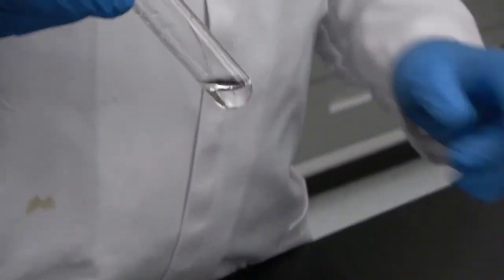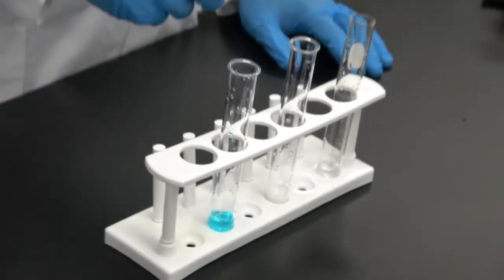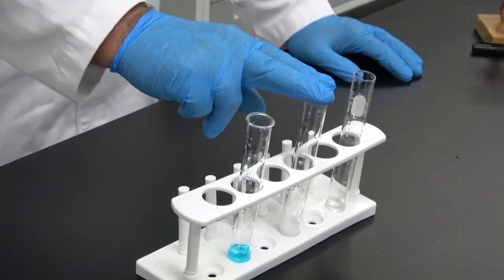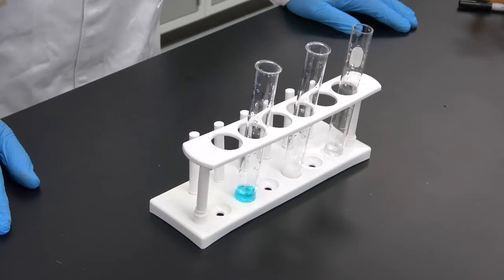In this case, we have elapsed about a minute and a half of time, and you see that there is no precipitate formation. So the last part will be no formation of precipitate, and no formation of precipitate for each one of the unknowns.